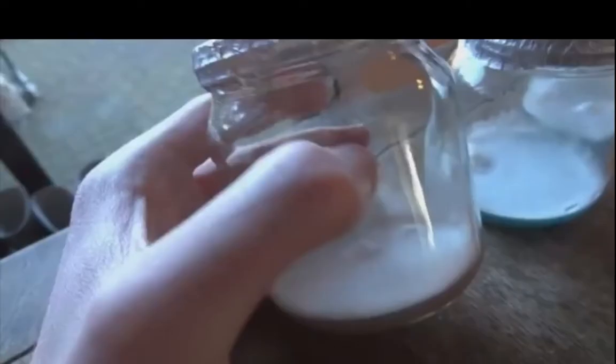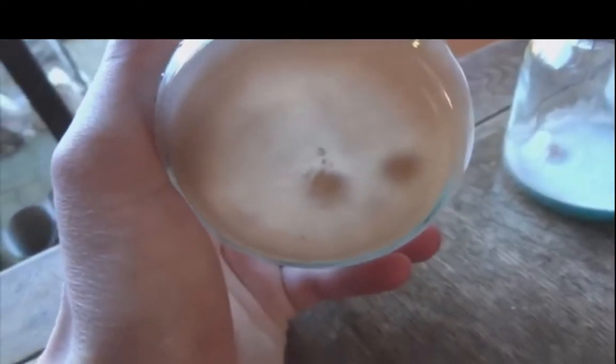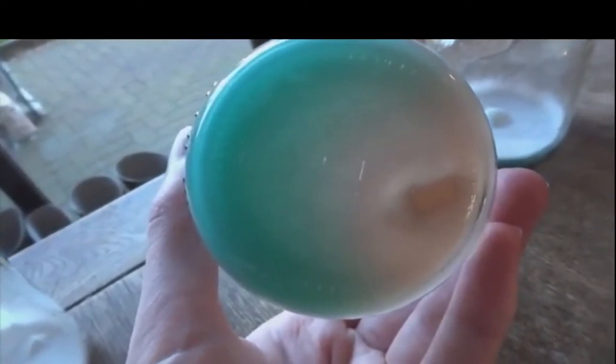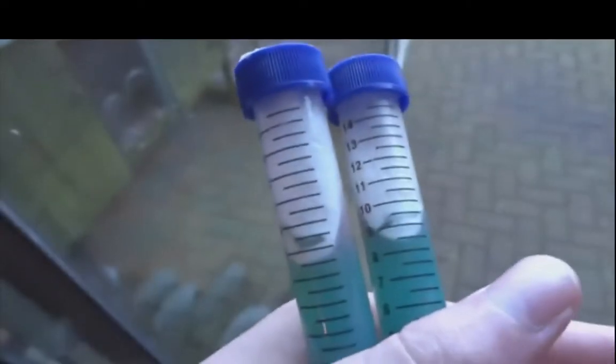You could cut them into cubes and use them to seed spawn jars. That's good, but it does require you to open up every individual spawn jar, cut a chunk of agar and do it. So I find the best thing to do is to make liquid cultures. This means you only need to cut one small chunk of agar, put it into a nutrient liquid, and this allows you to easily make literally as much spawn as you could ever want.